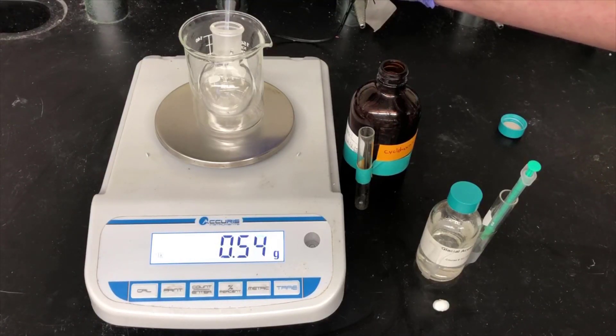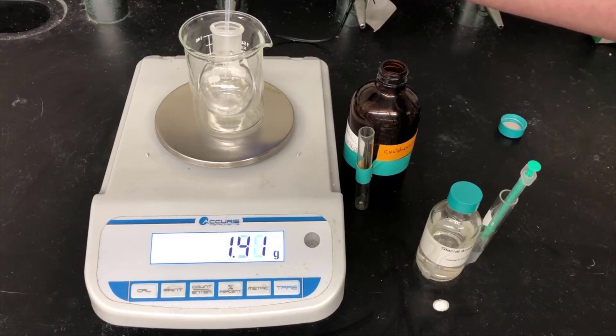You don't have to hit 1.50 grams exactly. If it's a little more or a little less, that's okay, but just make sure that you record the amount that you do add.